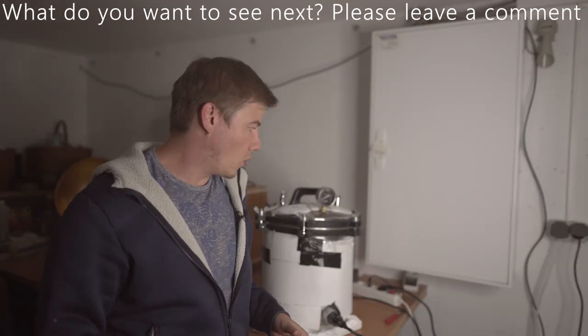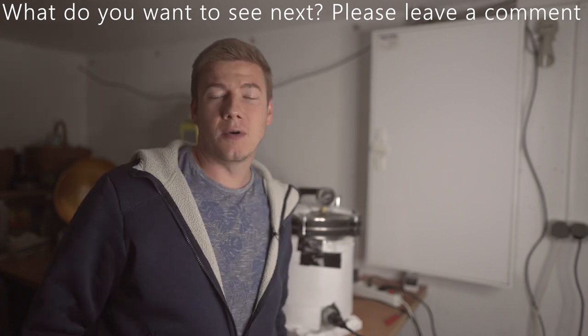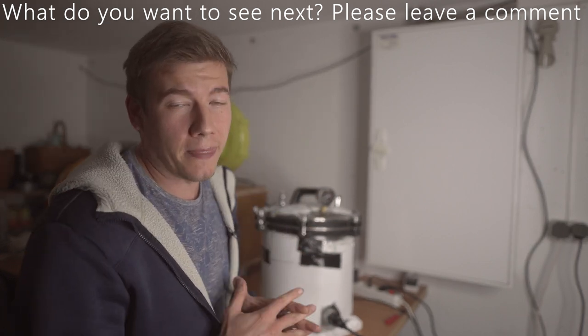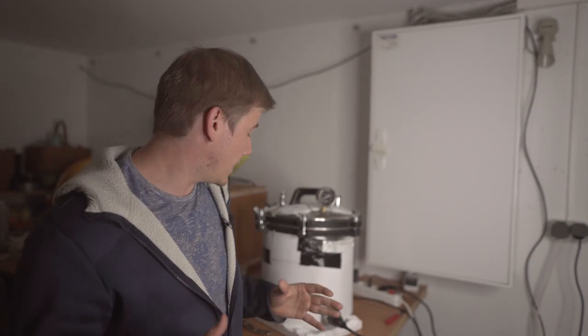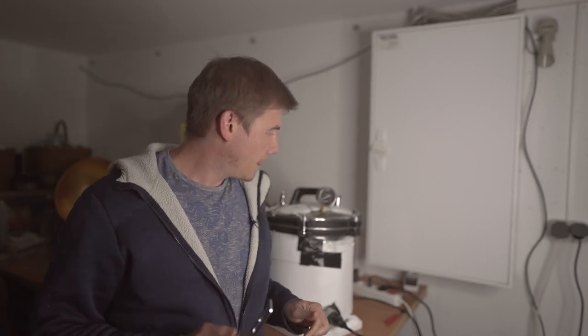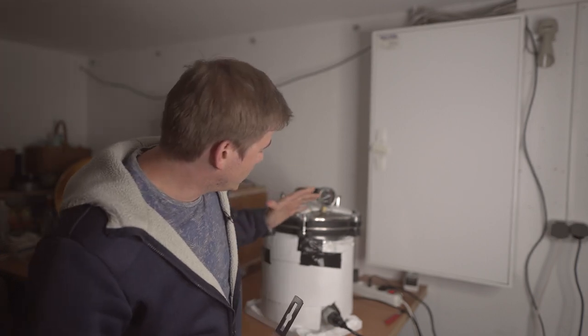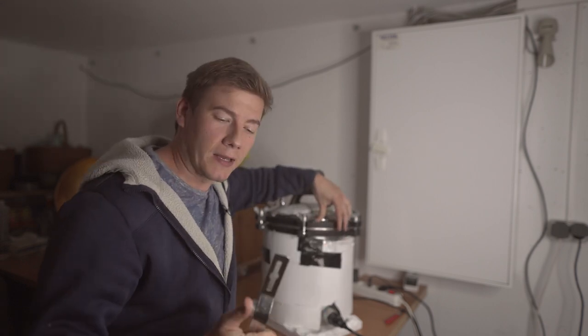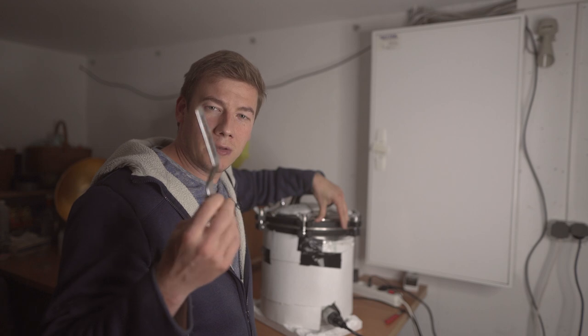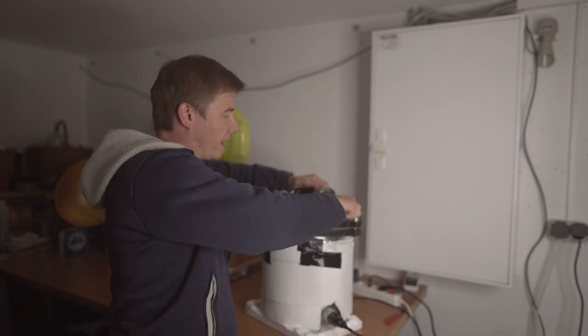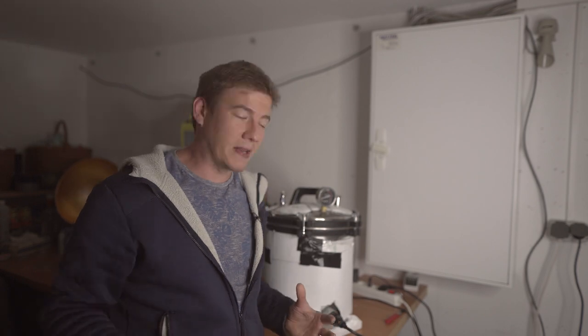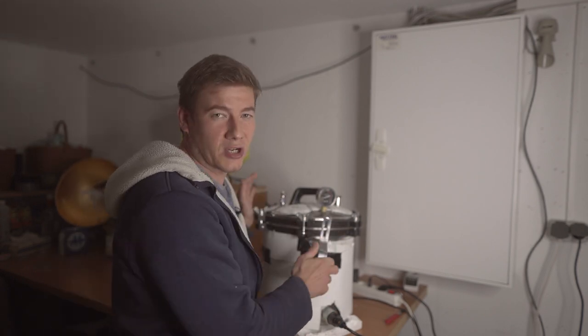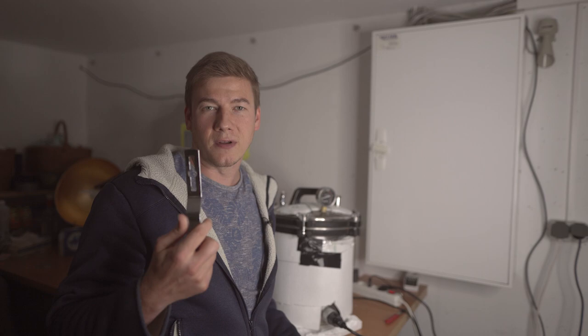The temperature is about 105 degrees at the moment, so I'll wait a little longer. Maybe a little tip: I had some issues where hot air came through the seals when the pressure was too high. So I'm using this tool to tighten them really extremely tight. When you're experiencing issues with hot air coming outside of your pressure cooker, maybe this is an interesting tool for you.